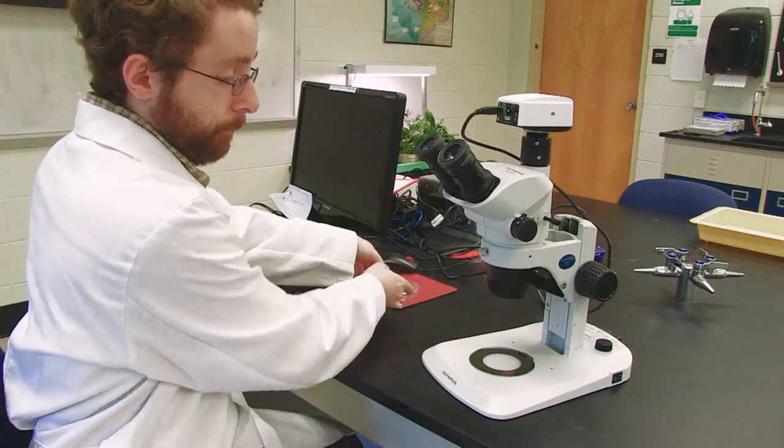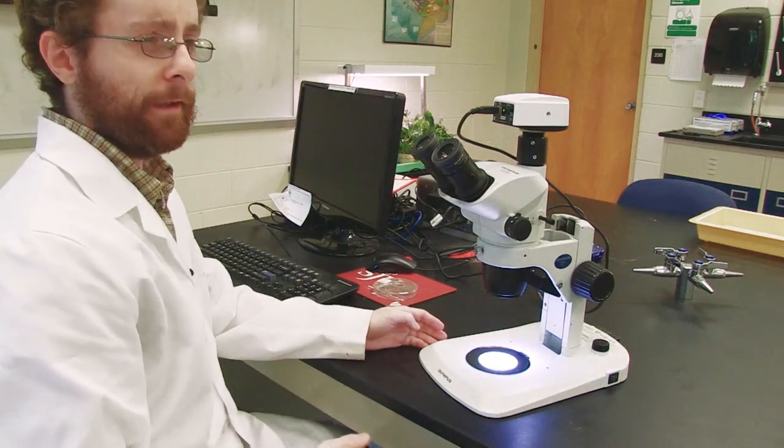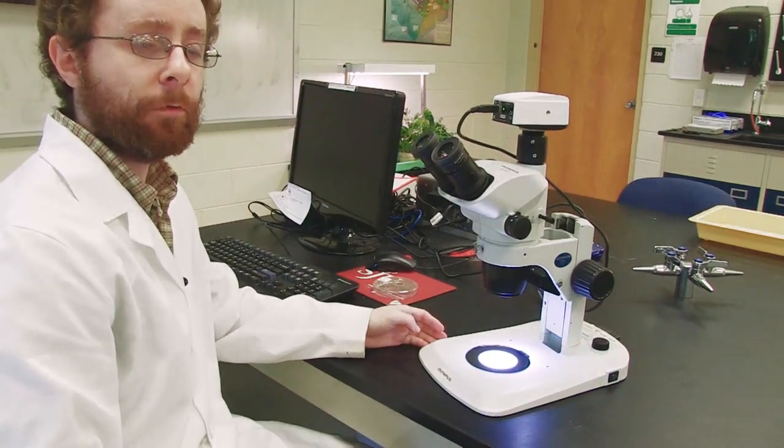So to begin, we turn on our microscope, and we next have to adjust the light.